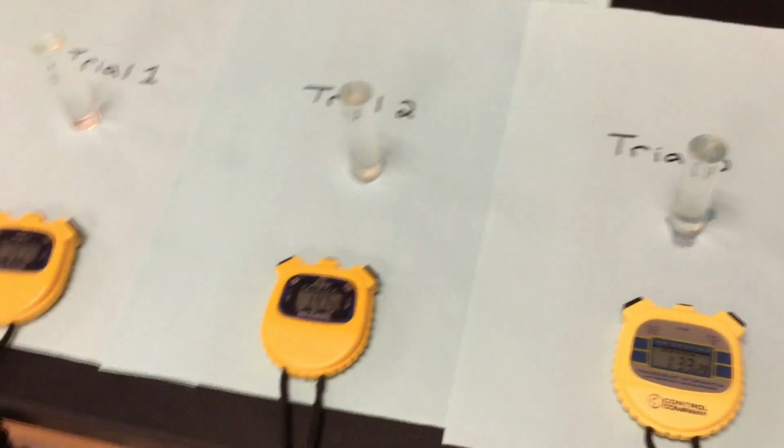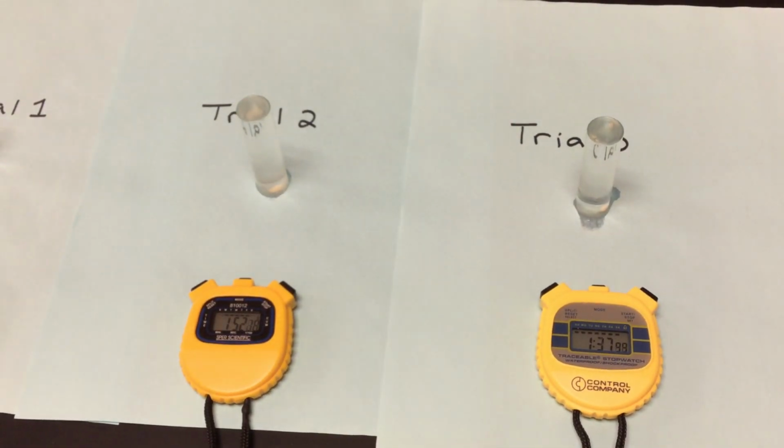But we have 3 trials running. So we want to see what happens with trial 2 and trial 3, and we're waiting for that to go up. And we're waiting for those discs to move. So you guys should be writing this information down. And we're still kind of waiting for those 2 other ones to go. Here comes the second one, kind of bobbing around in there a little bit. Third one's bobbing around a little bit in there as well.